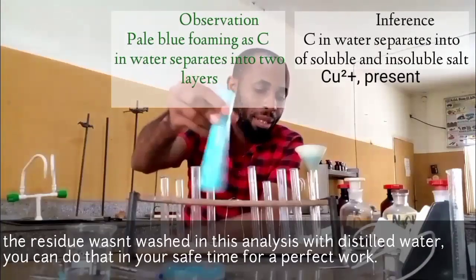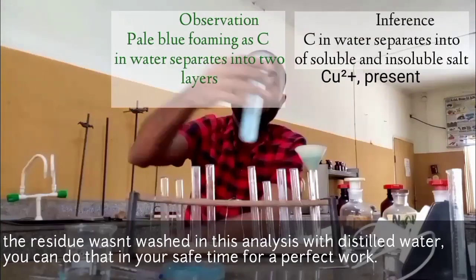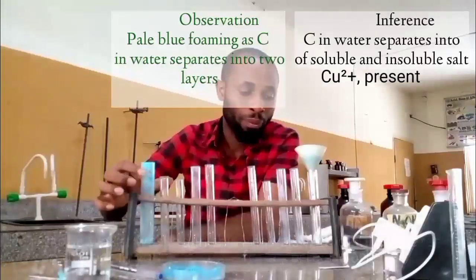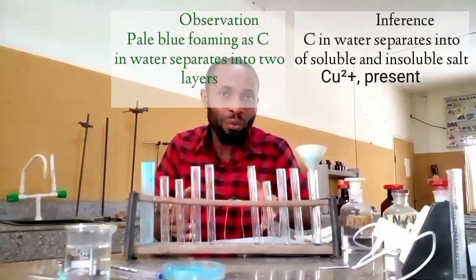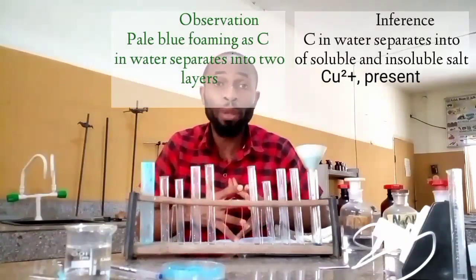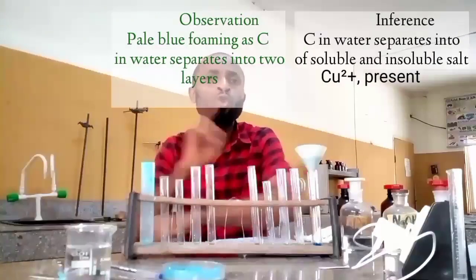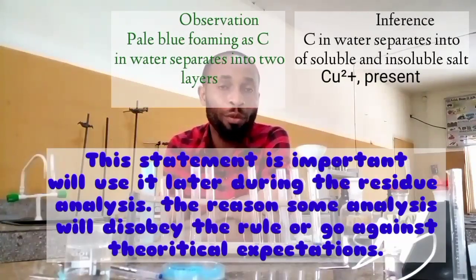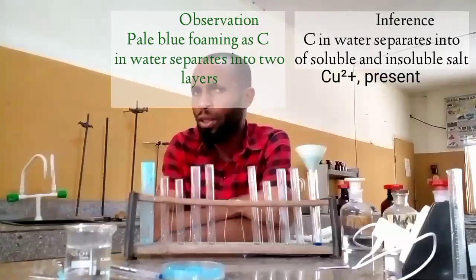As I'm adding a little water here, okay, I'm going to leave this for us to have it as a color. In reality, it will take you up to 5 minutes for the filtrate to be removed from this. But I am not going to wait for all the filtrate to be removed before I carry out the chemical reaction. And even in your exam, you can still do the same.